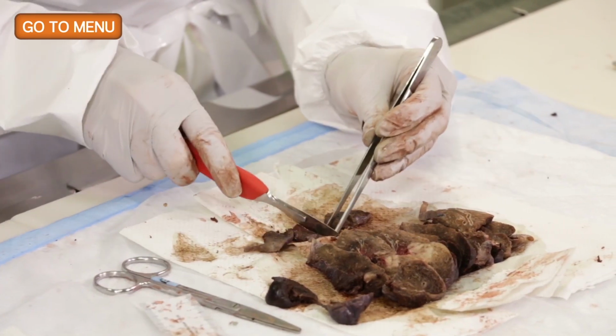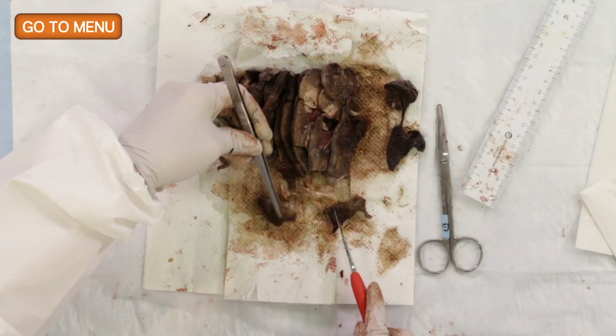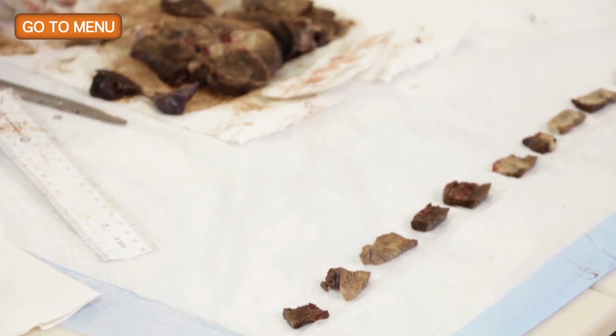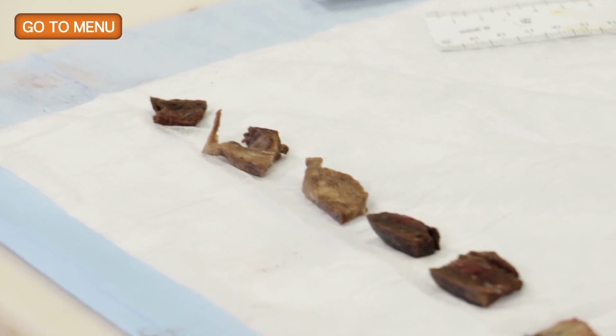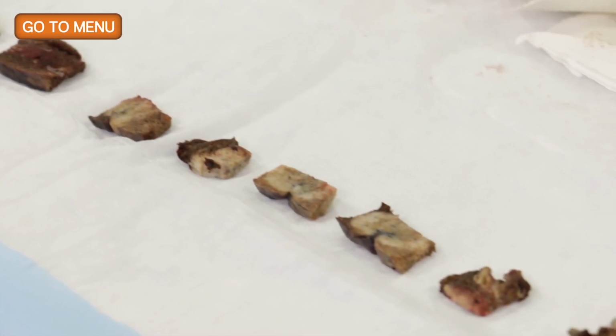With that, I think we've searched for lymph nodes. We did find an additional small lymph node or 2. We have sampled normal lung parenchyma, and we found another area which we're concerned about enough to look at it microscopically. And so with that, why don't we review the sections we've taken from this part of it, which would be the sectioning part of the gross examination.